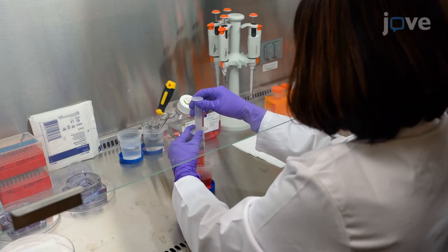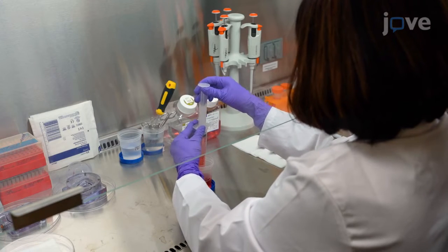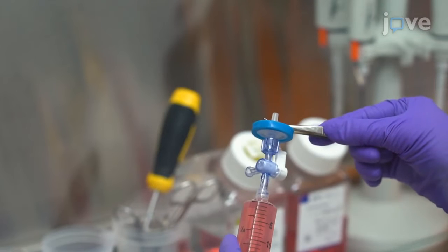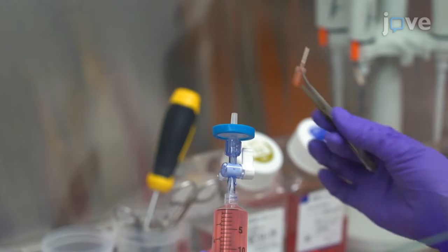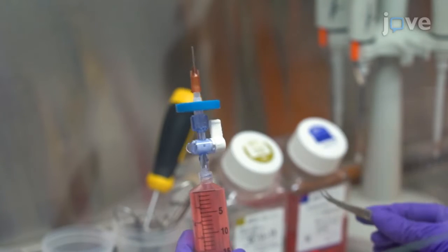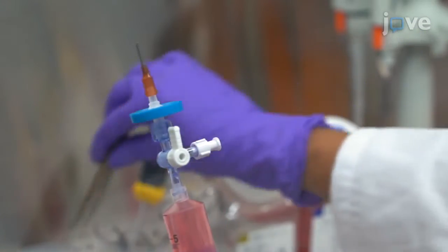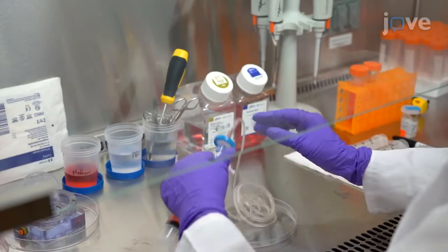To set up the inflow syringes, load a 30 milliliter syringe with 30 milliliters of the perfusion fluid of interest and attach a three-way stopcock to the syringe. Attach a 0.22 micrometer hydrophilic filter to the stopcock and attach a 15-gauge luer stub adapter to the 0.22 micrometer hydrophilic filter. After removing air bubbles from the syringe setup, attach tubing to the luer stub adapter and close the side port of the stopcock with an unvented universal lock cap.